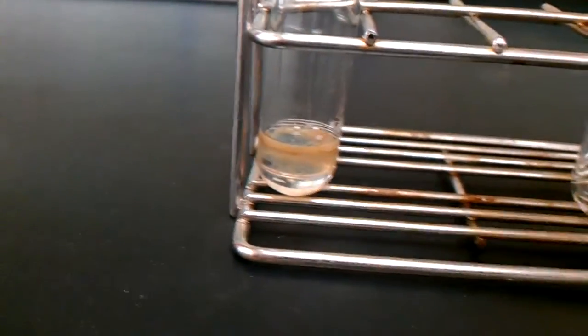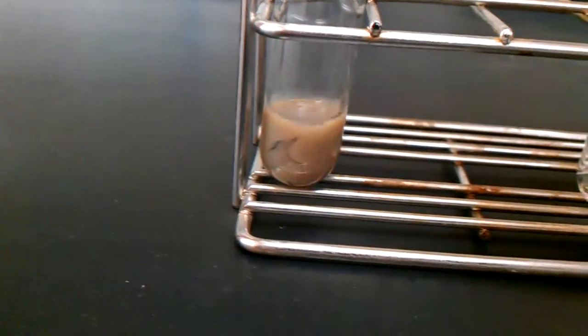Here we go, you can see the brown precipitate formed. Oh look, that's pretty nasty.